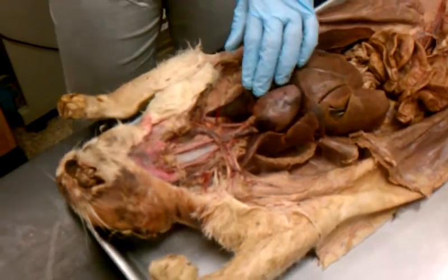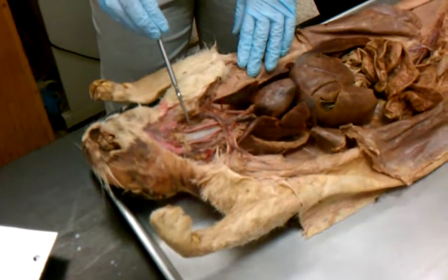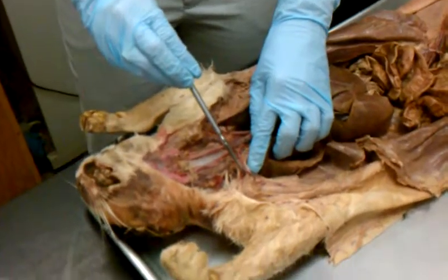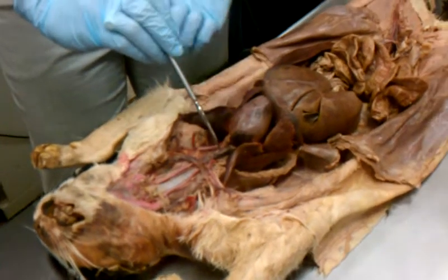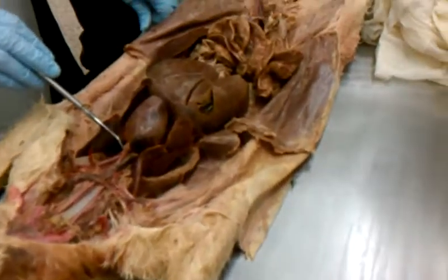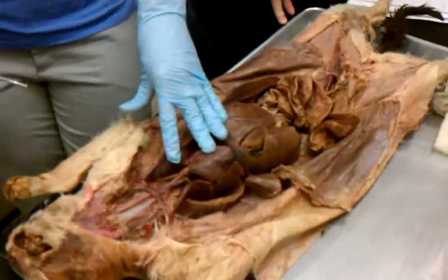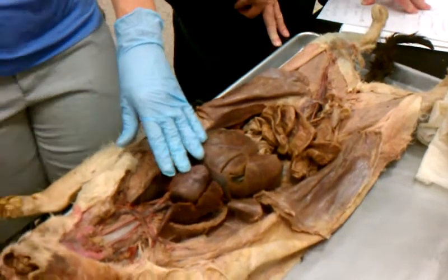So if I pin these, I'm not going to pin it where it's very difficult. If I'm looking for left common carotid, I'm going to do it up here. Right common carotid, if I'm looking for right subclavian, I'll do it right here. Left subclavian over here. If I'm looking for brachiocephalic, it'll be right in the middle. Aortic arch, I'll ask you for the structure of the artery. So that'll be aortic arch. If I'm asking you for the artery, put aorta. Do all those make sense to everyone so far? Structure equals aortic arch.